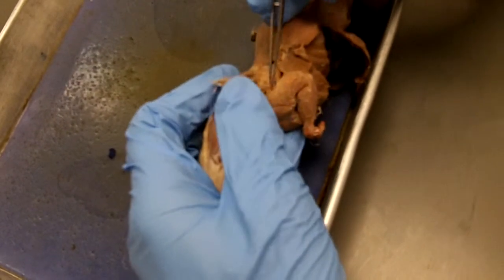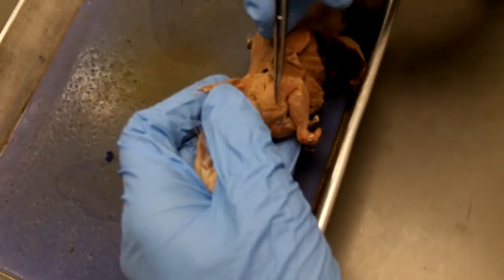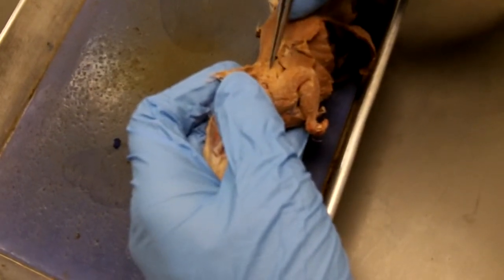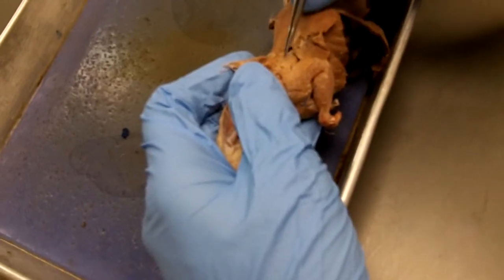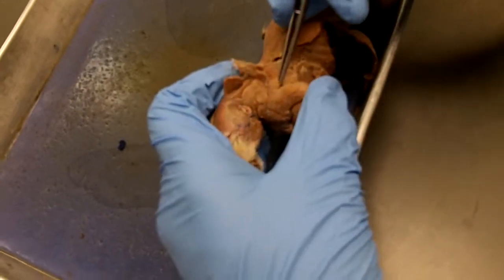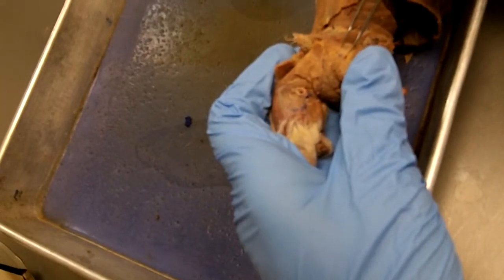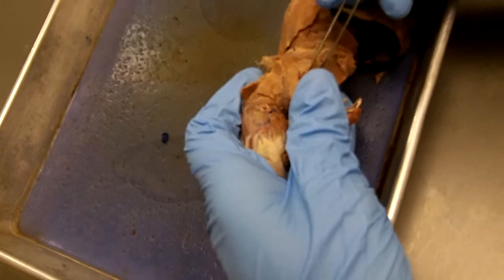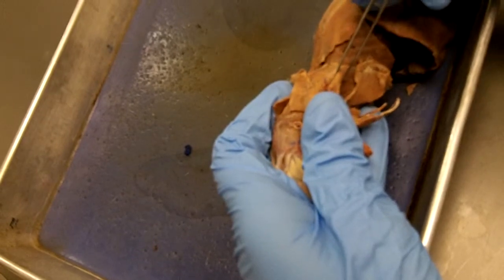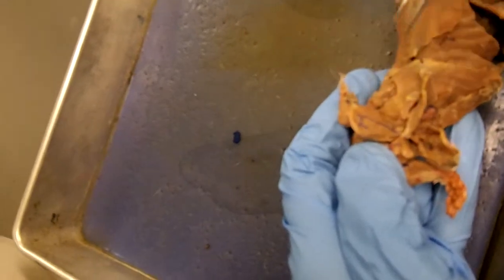And when we look at the lateral aspect of the scapula, we can see a big muscle right here that goes up like this and comes down like that, and that's called spinodeltoid. Spinodeltoid stops and attaches to the surface of this other muscle right about here. So that's cut off on this. We've broken it loose here so that we can look underneath it. And the muscle that's underneath there is infraspinatus. So it's all of this muscle about this wide. And then below that, posterior to that, is teres major, which is attached to the back edge of the scapula. And then underneath the scapula, that's subscapularis right there.